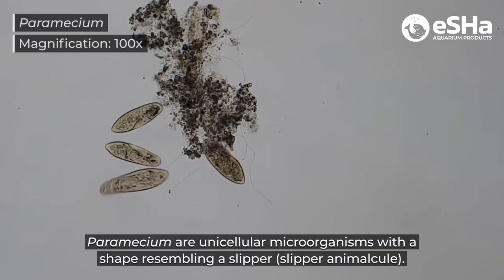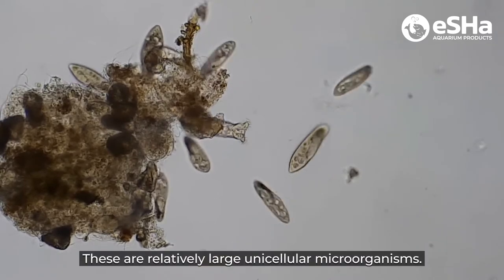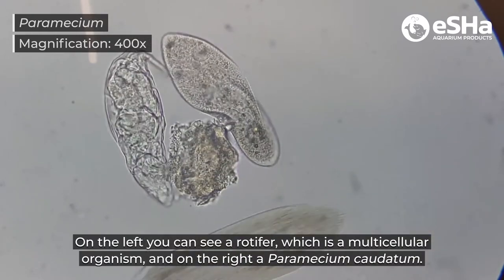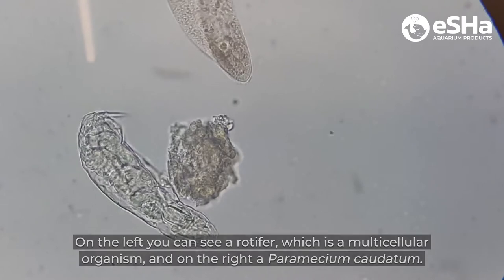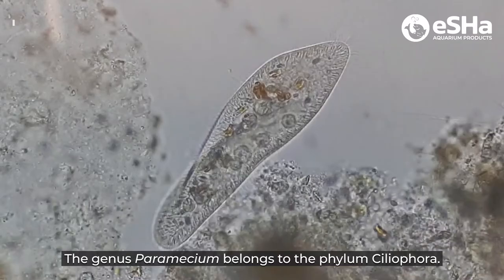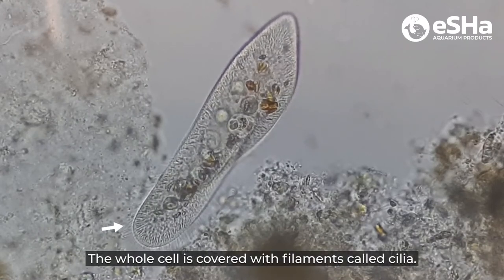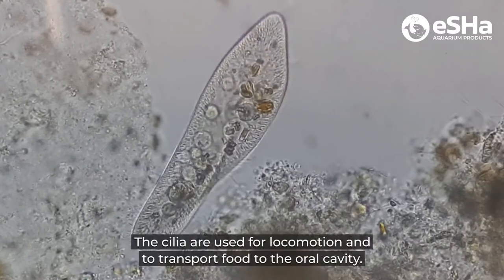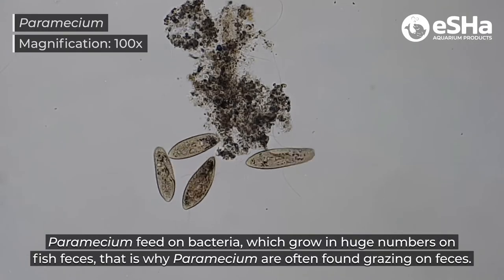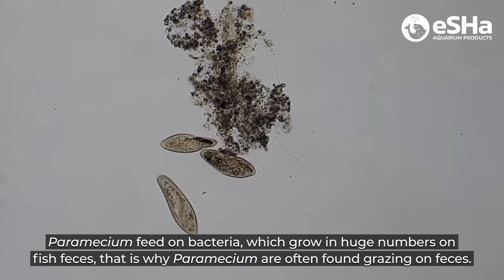Paramecium are unicellular microorganisms with a shape resembling a slipper. These are relatively large unicellular microorganisms. On the left you can see a rotifer, which is a multicellular organism, and on the right a Paramecium caudatum. Paramecium are mostly found in freshwater environments. The genus Paramecium belongs to the phylum Ciliophora. The whole cell is covered with filaments called cilia, which are used for locomotion and to transport food to the oral cavity. Paramecium feed on bacteria which grow in huge numbers on fish feces, and that is why Paramecium are often found grazing on feces.